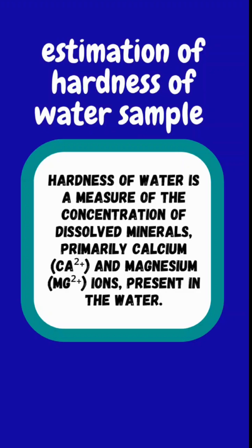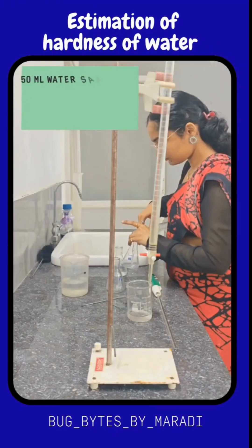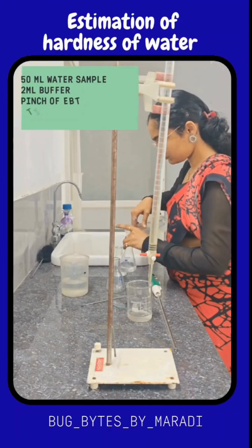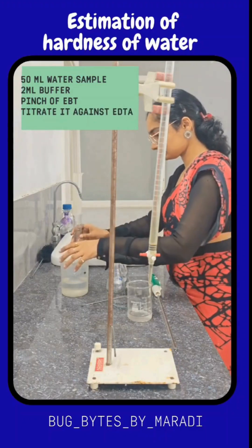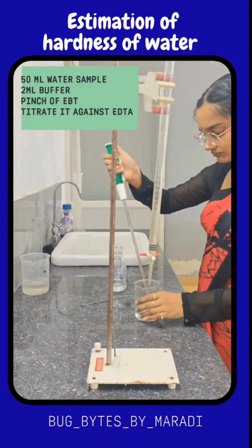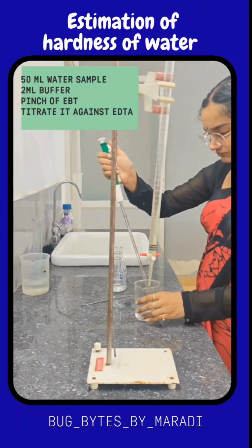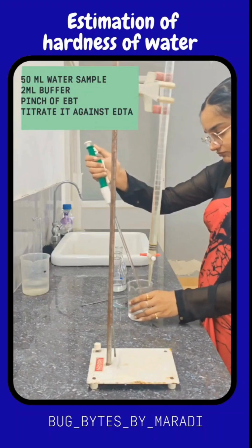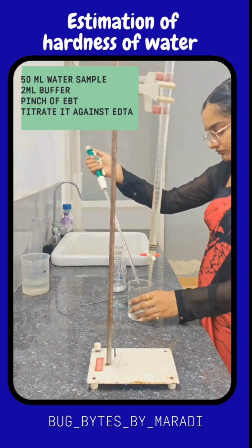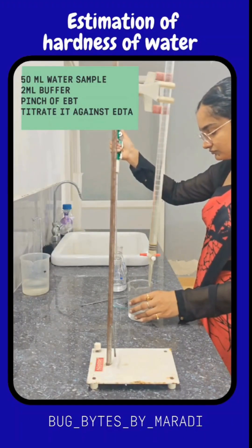So let us begin with the experiment. We have to take 50 ml of water sample, 2 ml of buffer and a pinch of EBT, and titrate it against EDTA. After taking all these things, the water sample, buffer, and EBT have been added.